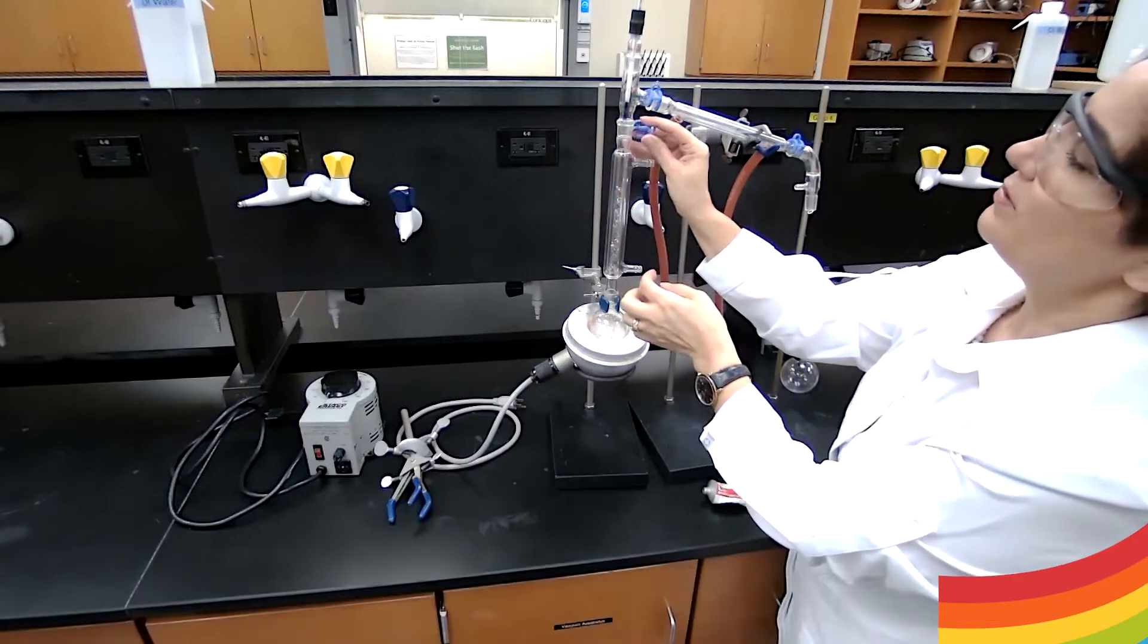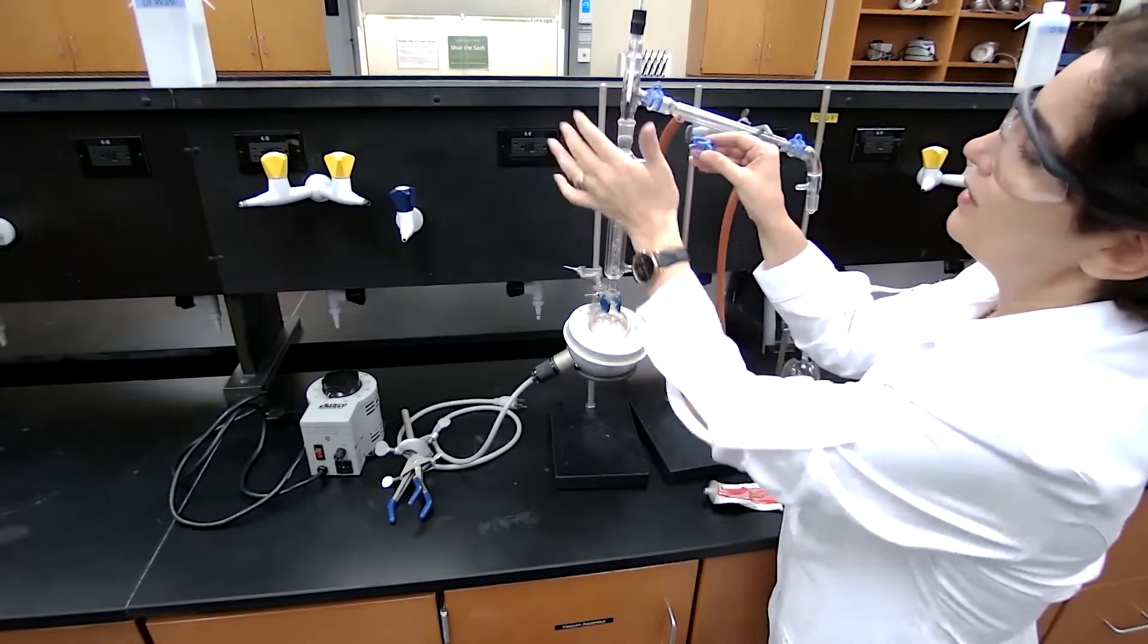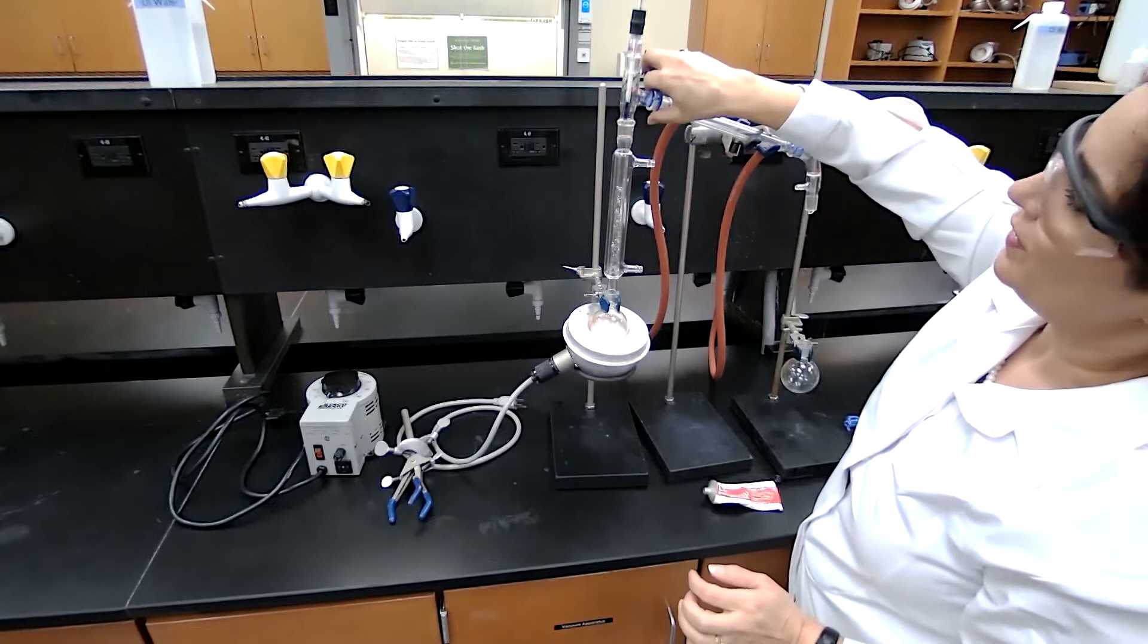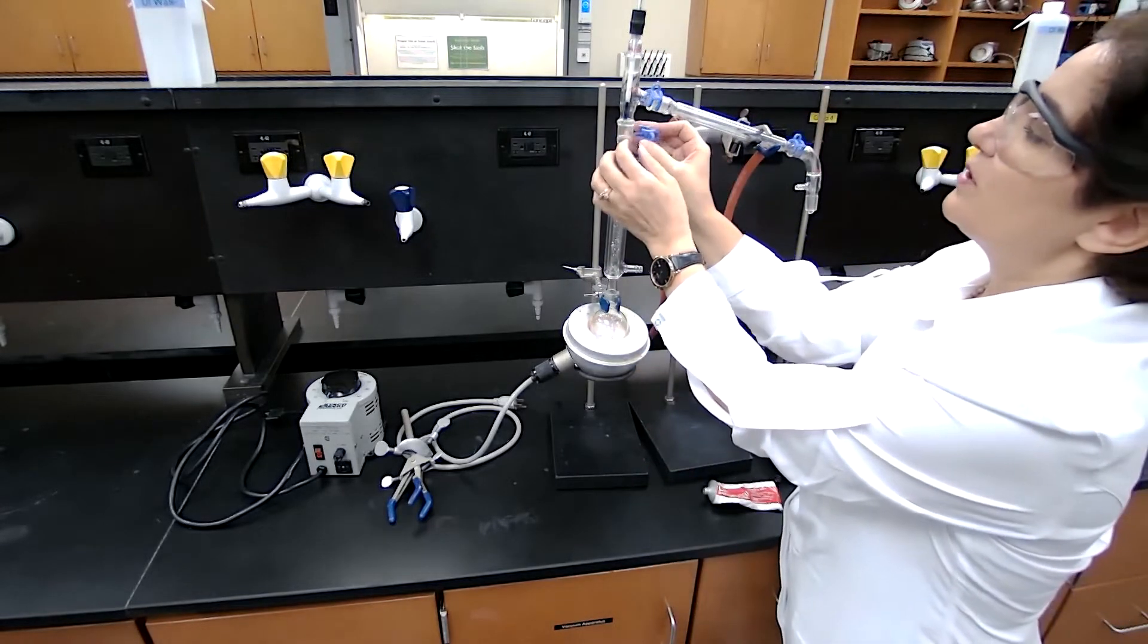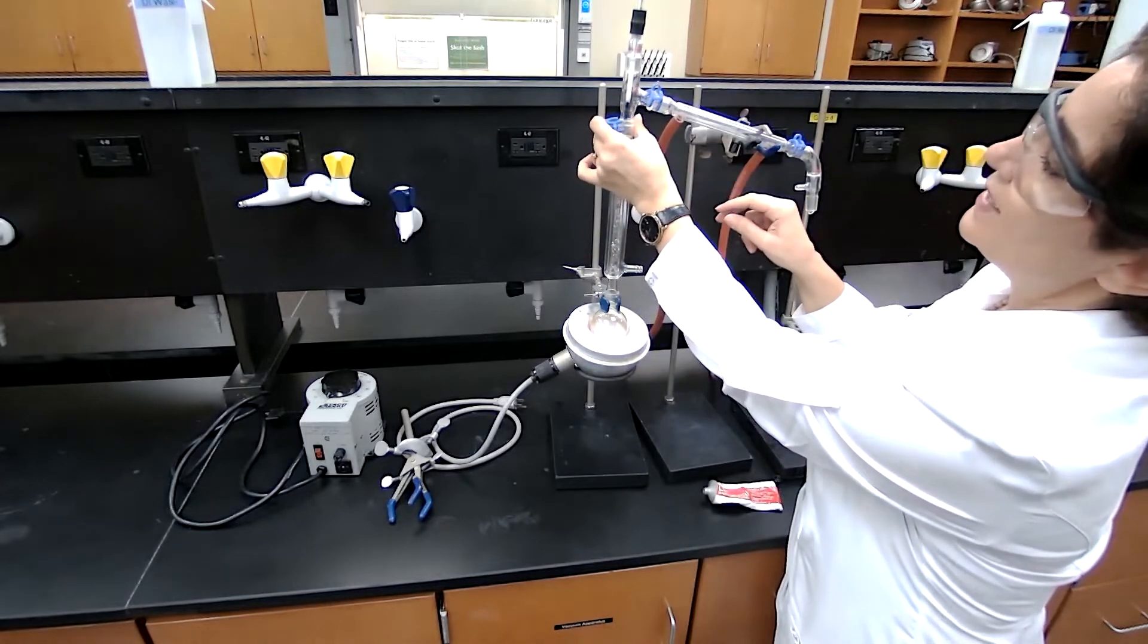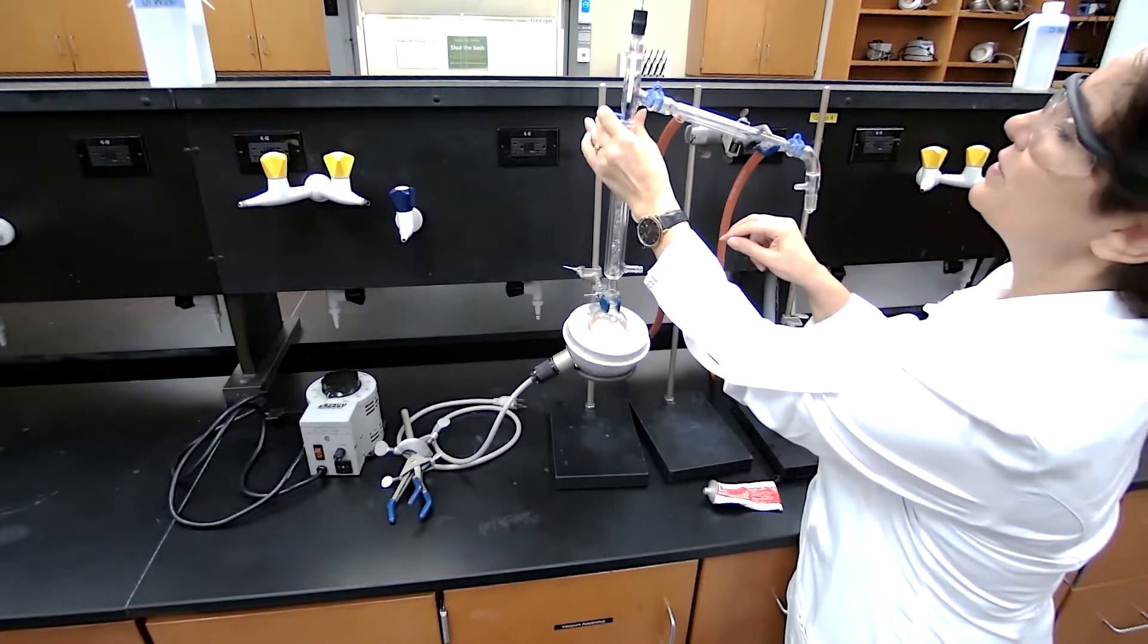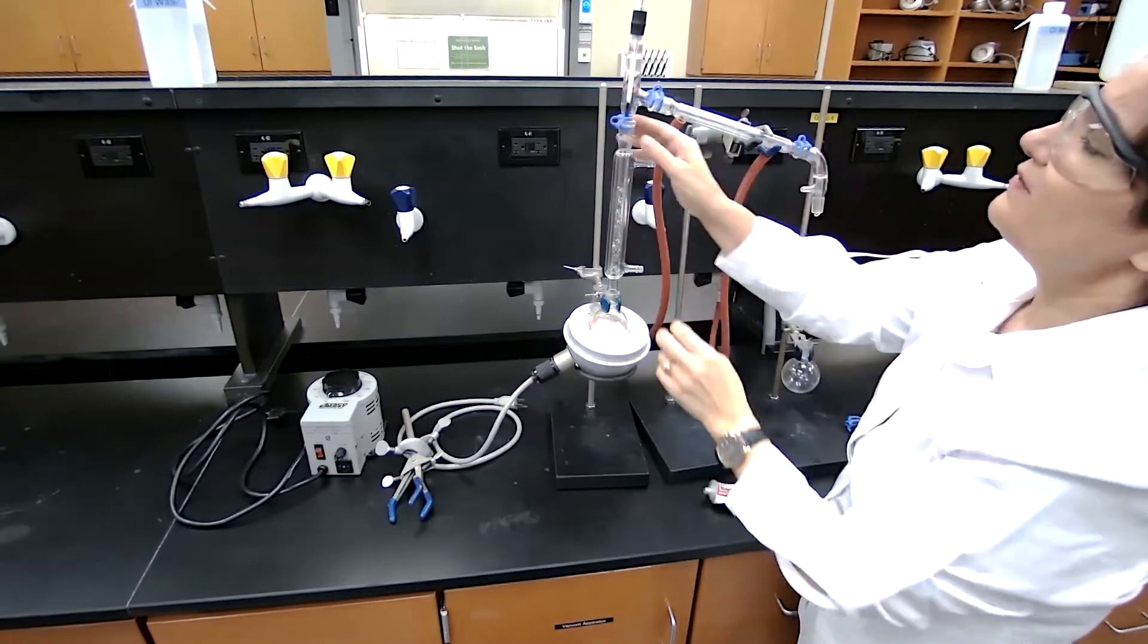The way you insert it, you are going to push from one side, but if you don't support it, it will break the glass. Even if you're going up here, you have to support it. If you're doing it with one hand, you press it from one side with two fingers and place your thumb on the other side and push. Now if you put it in the wrong direction there would be no use for it.